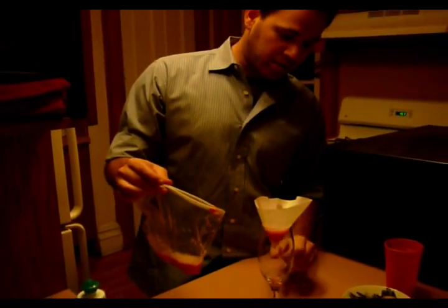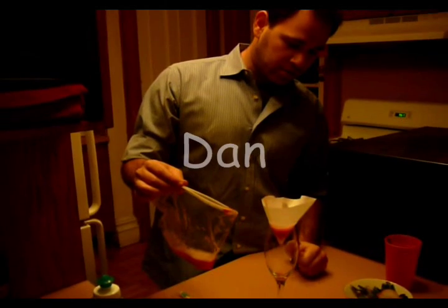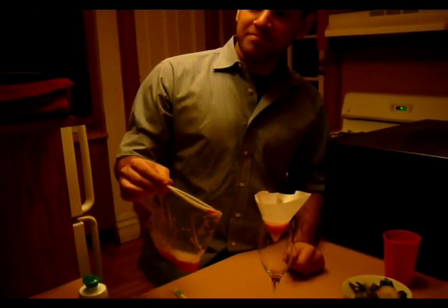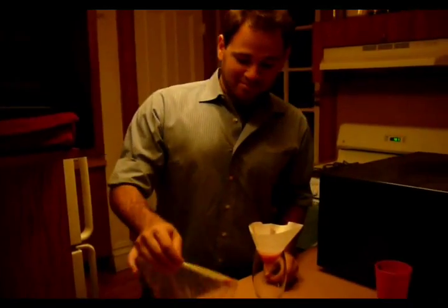So, in this juice is going to be what? In the juice is DNA along with strawberry essence, basically. Fantastic. DNA for pizza! So embarrassing.